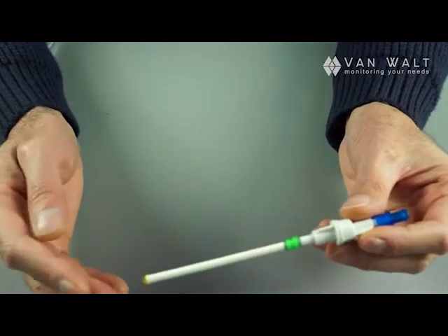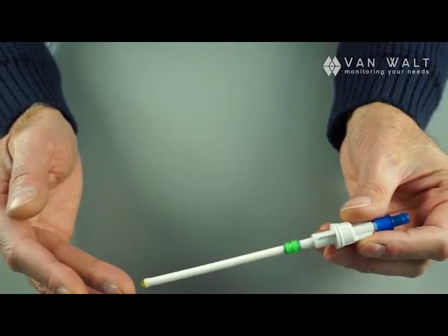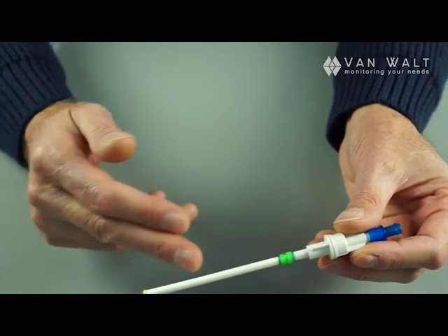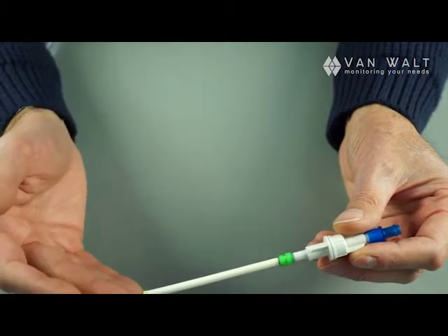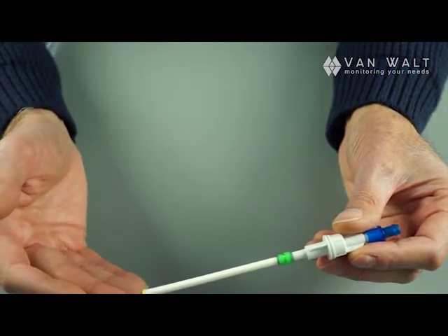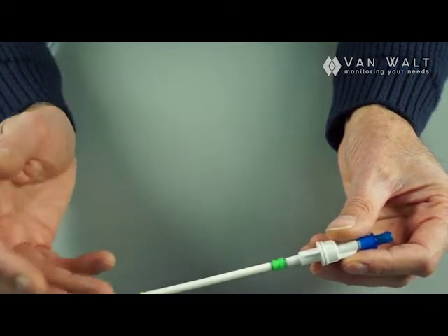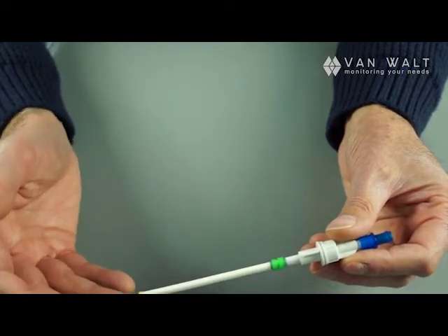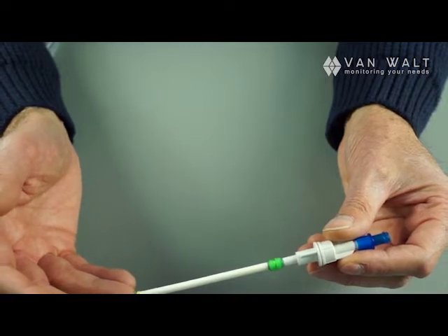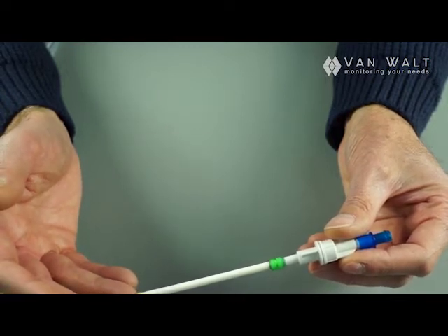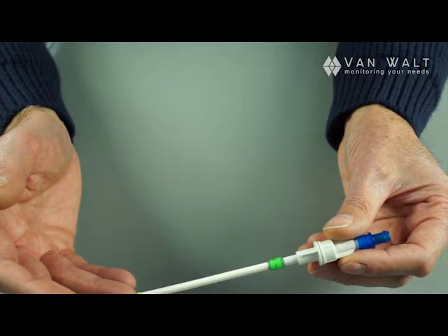Once we're discussing these, you'll have noticed that I've been quite careful not to touch the polymer with my hands. Always make sure that if you need to touch it you wear gloves, but better not to touch it at all because the grease on your fingers will block the pores.